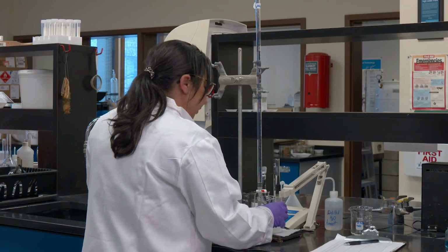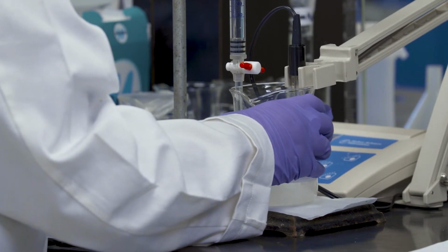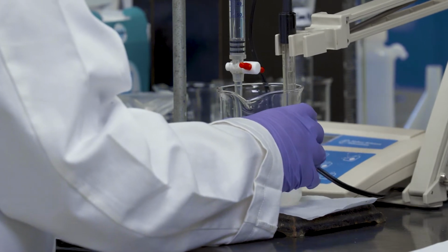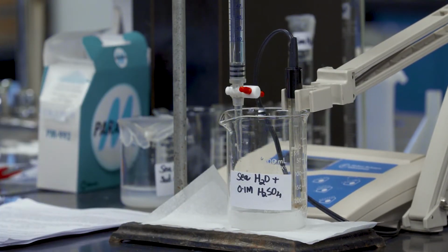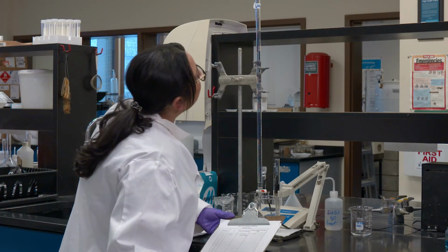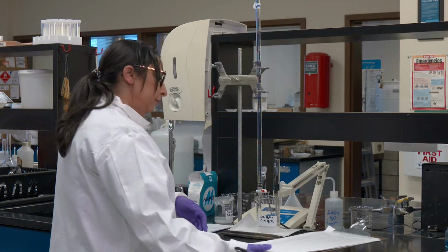The important point here is to make sure, before you start looking at your pH meter, to stir it, because you want to mix the acid you are adding into your solution. You can move the probe a little bit and give it a gentle stir, and then just leave it alone to stabilize so that the pH meter can give you a reading. So this was another ml that I went down. I started at 10 and now I'm at 12 ml. So far I have added 2 mls.